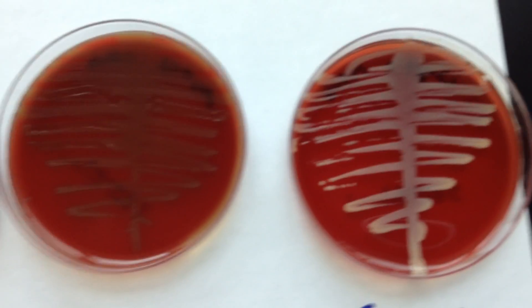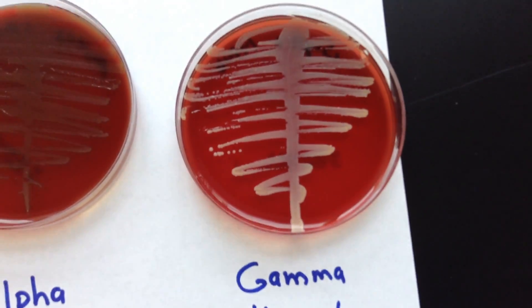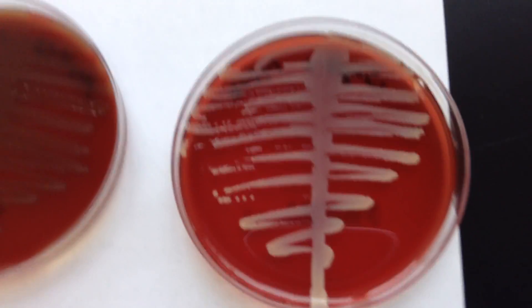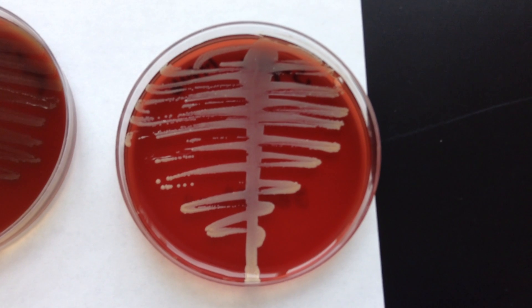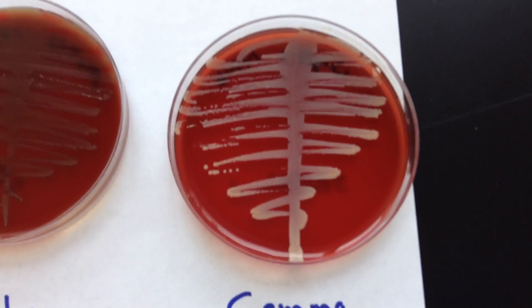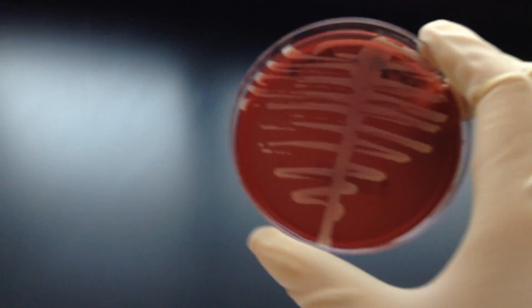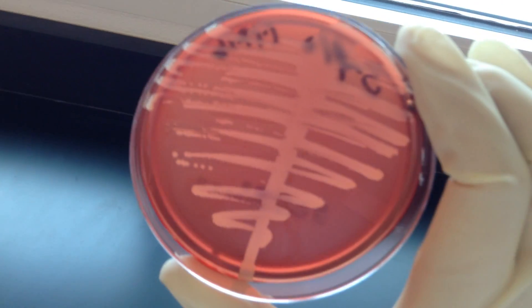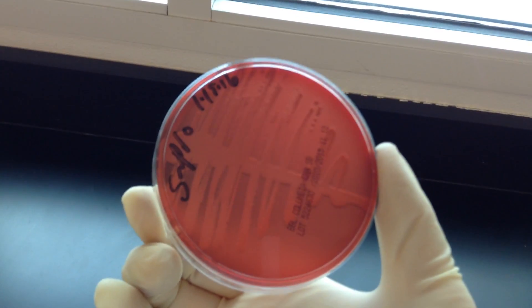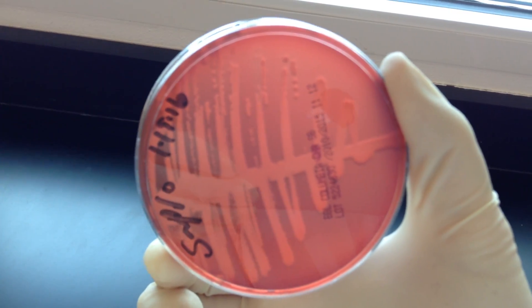The third type of hemolytic reaction is actually no hemolysis, but we do give it a name — gamma hemolysis. Gamma characteristically has a shiny white growth on the top. This organism does not possess hemolysins, so there is absolutely no digestion of the blood in the plate. It's not that greenish color — it's a nice white color. When we turn it over, absolutely no breakdown of blood in the plate.